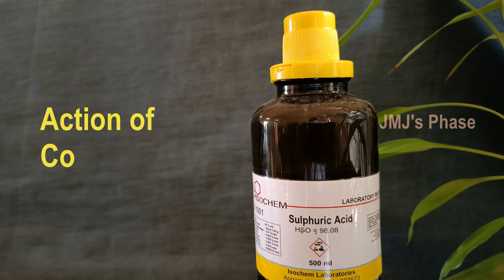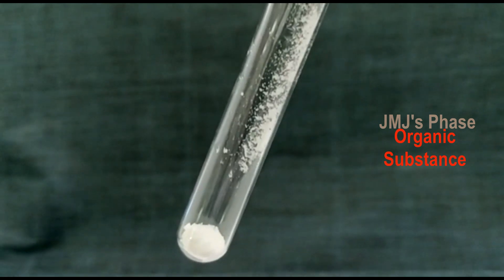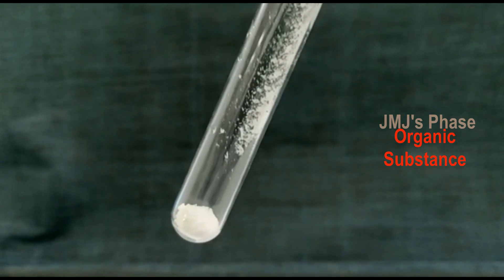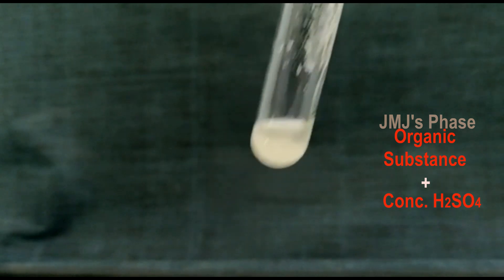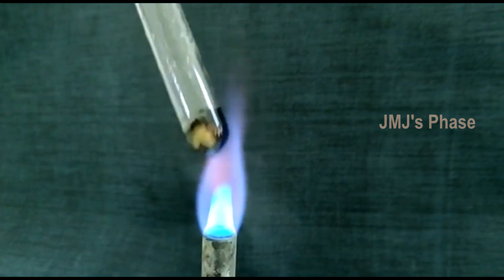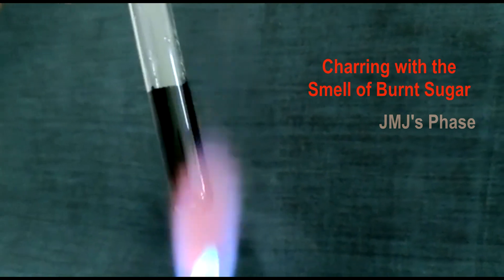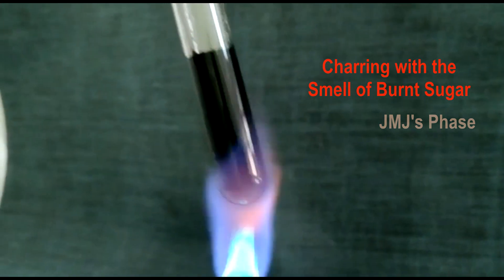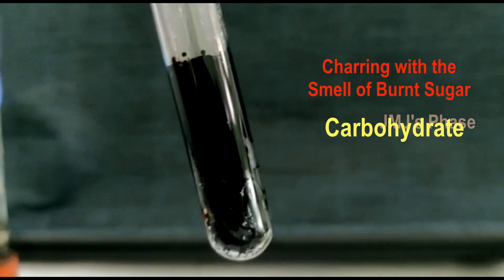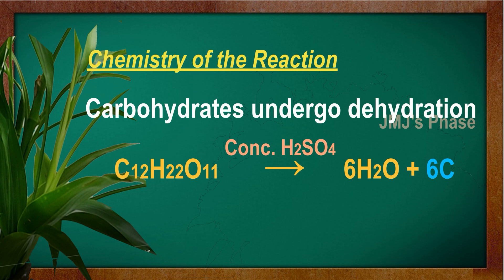Action of concentrated sulfuric acid: Take a little of the substance in a test tube. Carefully add a few drops of concentrated sulfuric acid and heat it. If you observe a black color — that is charring — with the smell of burnt sugar, it is an indication that the compound is a carbohydrate. The black color is due to the formation of carbon by the dehydration of carbohydrates on heating with concentrated sulfuric acid.